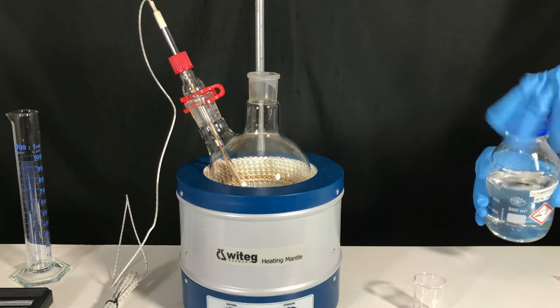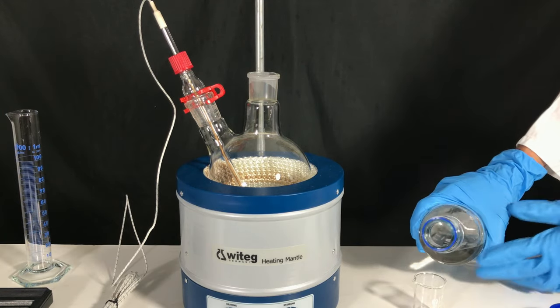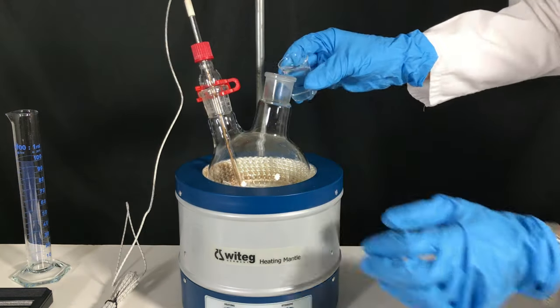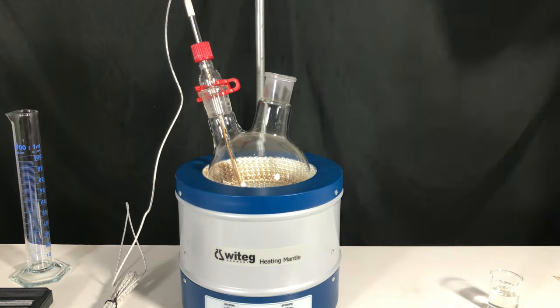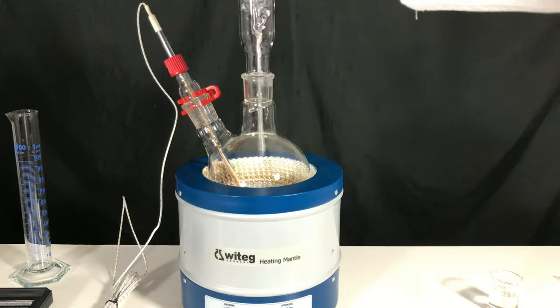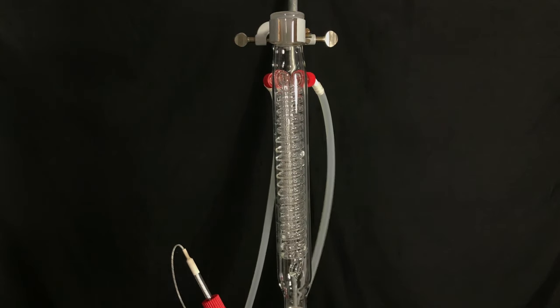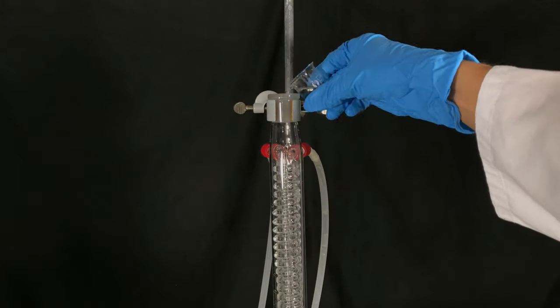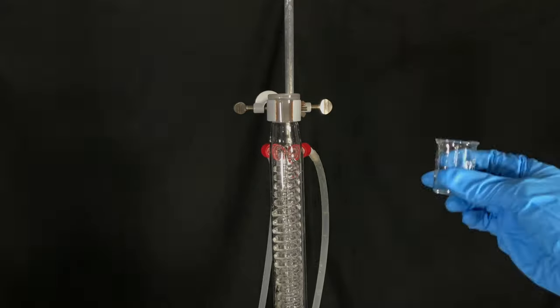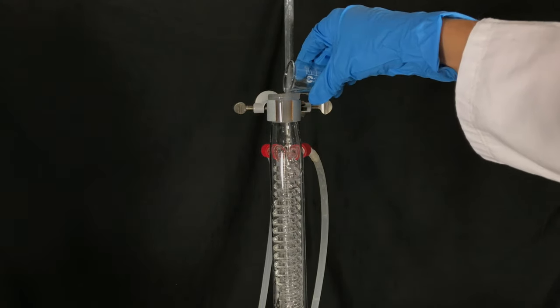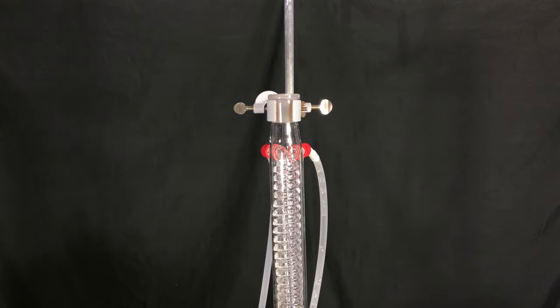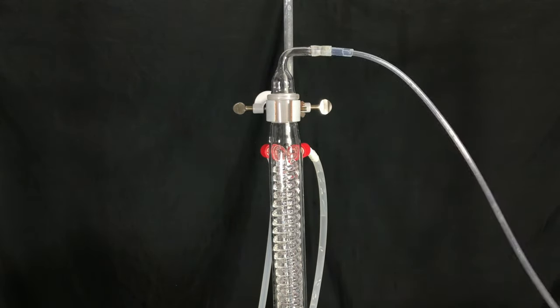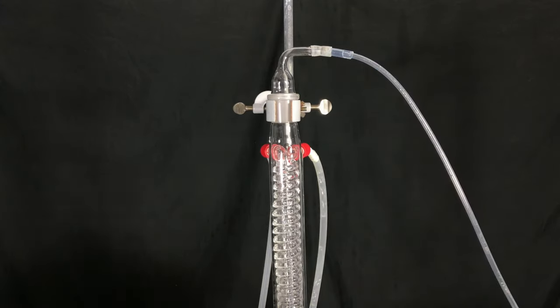Approximately 30 ml of sulfuric acid are added as a catalyst and dehydration agent. The addition of the sulfuric acid is actually exothermic, and therefore a reflux condenser was added to add in the rest of it. I did not want too much methanol vapors escaping the flask. Because of the reflux condenser, no more methanol escaped. For further safety reasons, an evacuation hose leading outside was attached to the reflux.